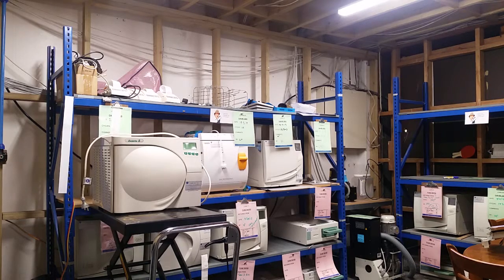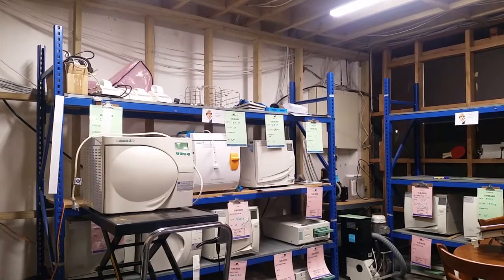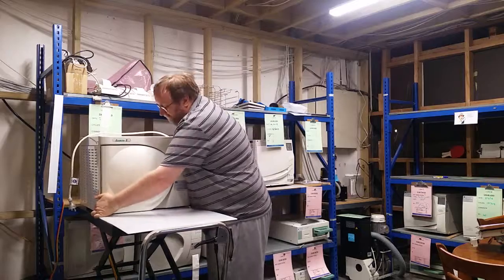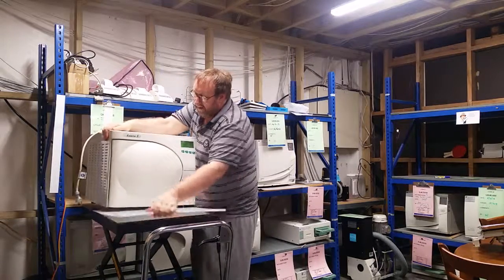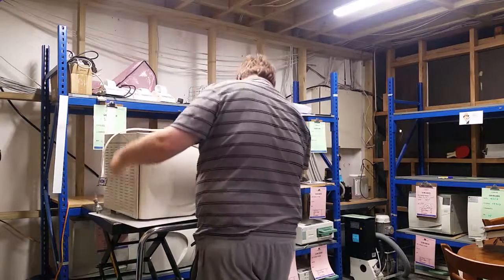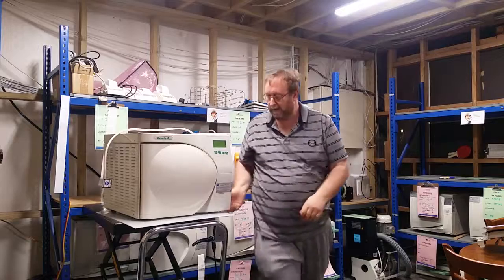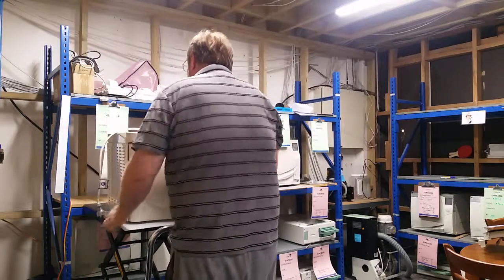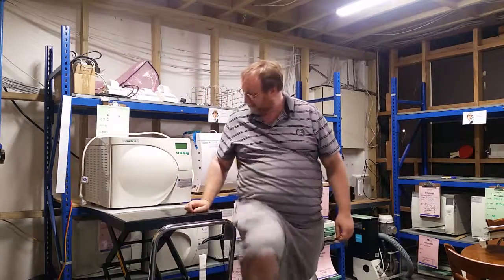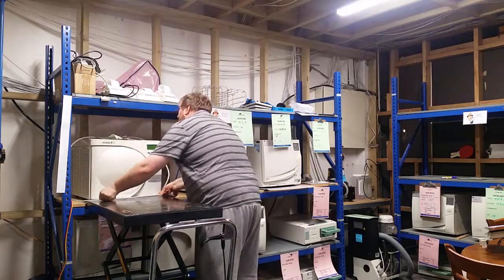So what we'll do is we've got mark one of the patented plastic chopping board. We'll lift, get the feet under, and the plastic sheet — there's a texture — and they sit on these plastic sheets. All we've got to do is slide it back, move that board, and just slide it back in place.